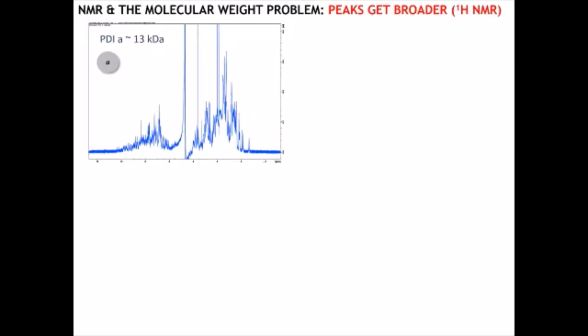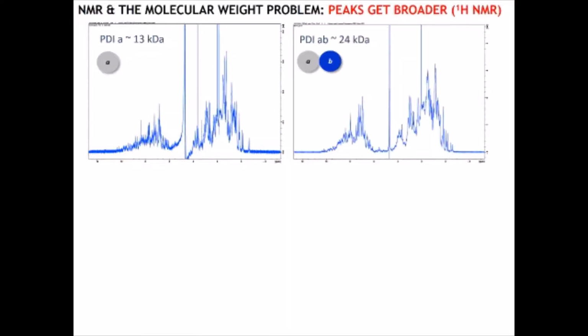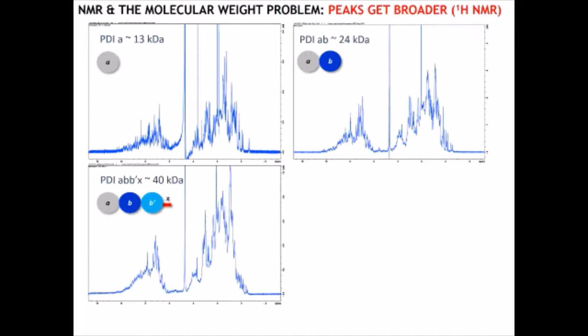So this is the NMR spectrum of the A domain. And you can see the peaks are relatively sharp. The spectrum is complicated because it's a fragment of a protein, but it can be interpreted. This is the NMR spectrum of the domains A and B together, 24 kilodaltons. And as you can see, the spectrum starts losing a bit of the sharpness of the peaks.